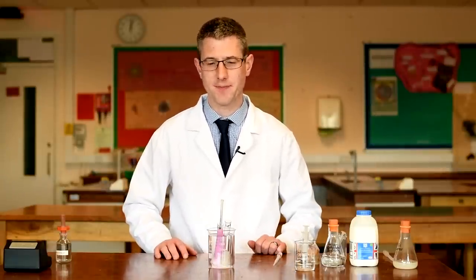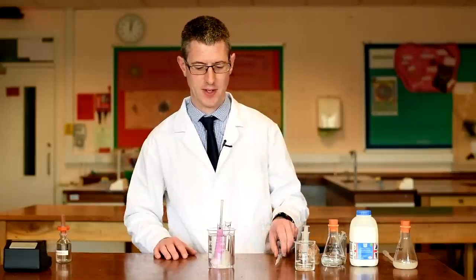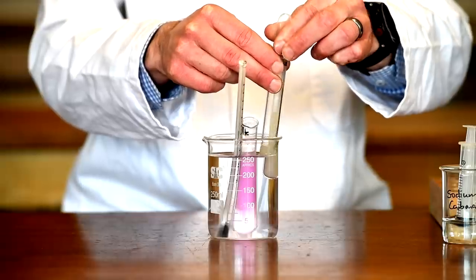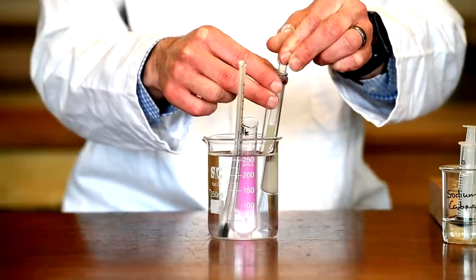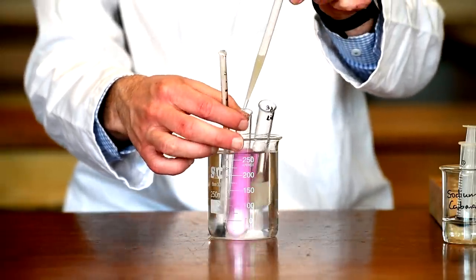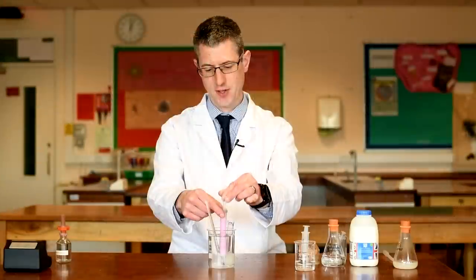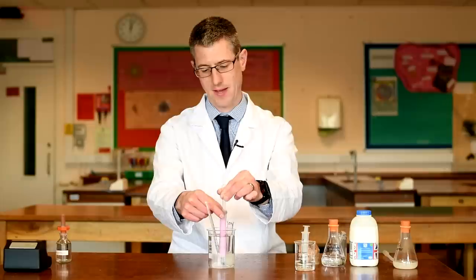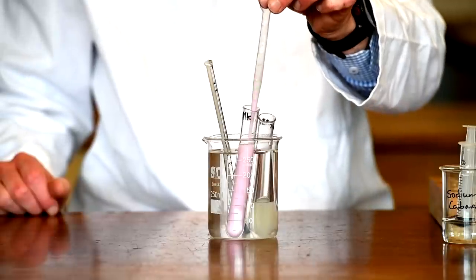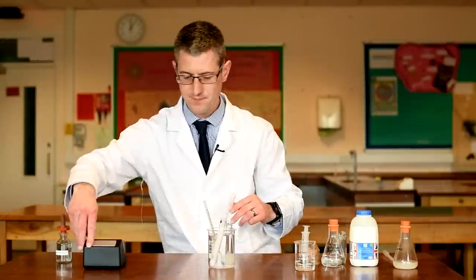Now that the milk has reached 60 degrees Celsius, we're going to add the enzyme — the lipase — and measure the time it takes to decolourise the phenolphthalein because of the production of fatty acids. I need to take 1 millilitre of lipase, making sure it's well suspended, and add it to the milk tube. Quickly pipette it up and down to give it a good mix, and hit start on the timer. This now needs constant gentle mixing — try and keep it the same at each temperature so it's acting as a control variable. You can see the pink colour is starting to fade as the lipids in the milk are broken down by the lipase. The milk has now decolourised — the pink/purple colour has all gone. Hit stop on the timer and record that result in the table.